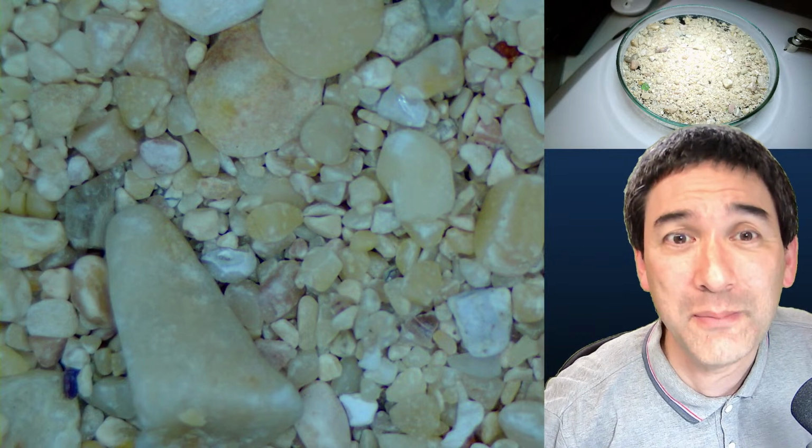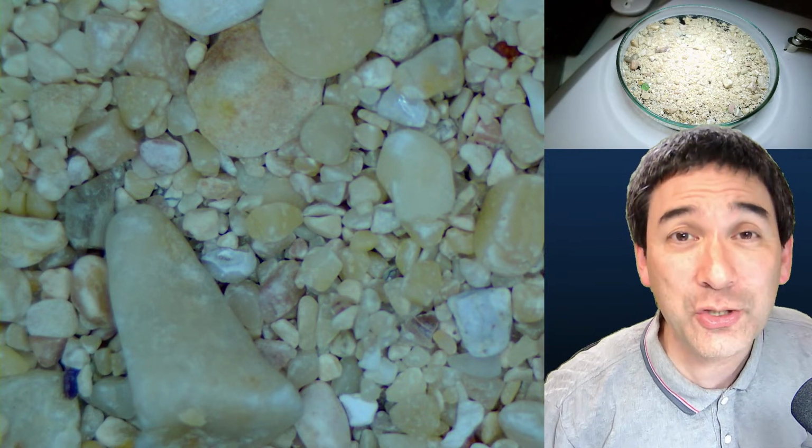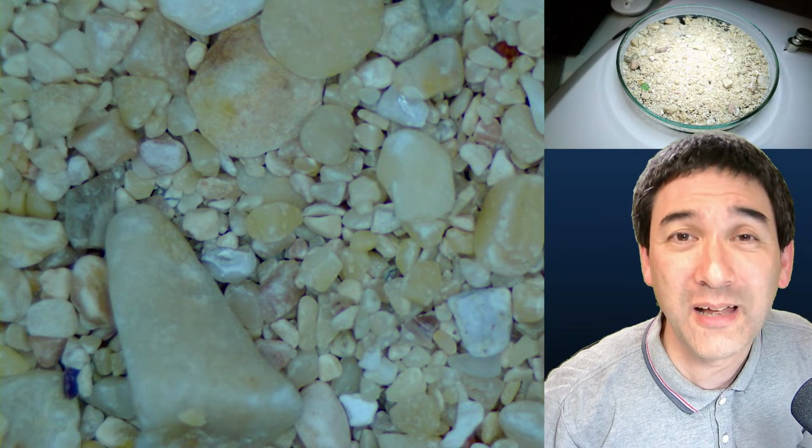Micrometeorites has been already mentioned, and even if I'm not quite sure if the round structures that you see are actually micrometeorites, maybe we can still have a look at them.